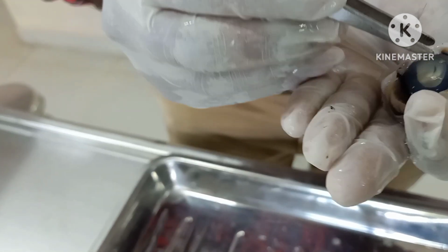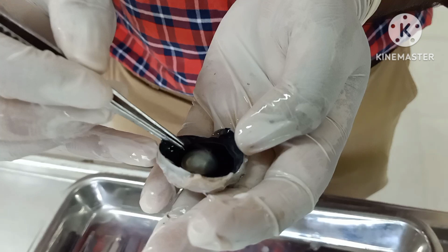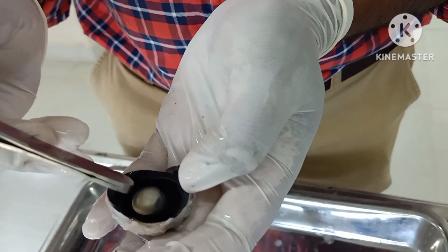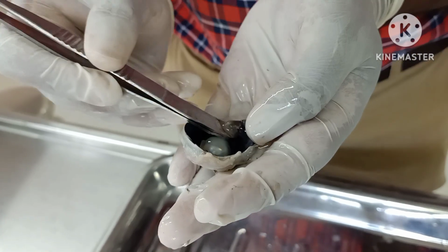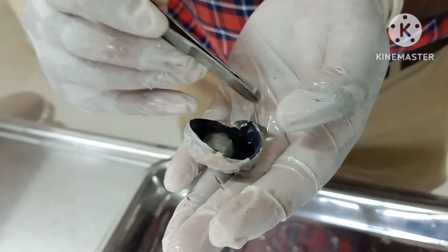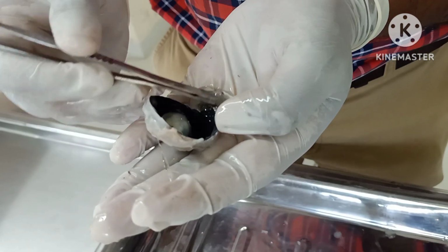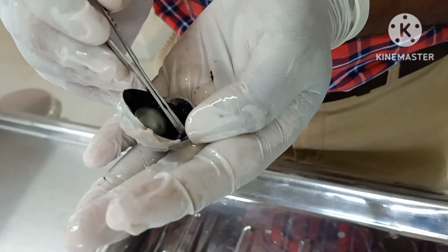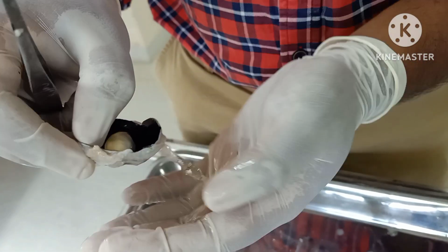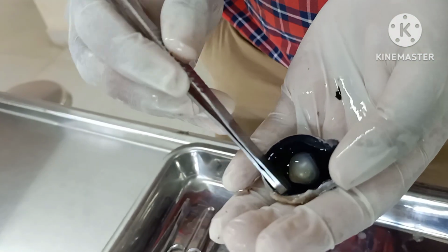Anteriorly you are having the cornea. So this is the cornea, this is the lens. In between the cornea and the lens is the anterior compartment, where there will be a watery consistency fluid which is present, that is called the aqueous humor. And behind the lens, what we saw was the large posterior compartment in which the vitreous humor was present. So what I am reflecting now, all these are the vitreous humor.